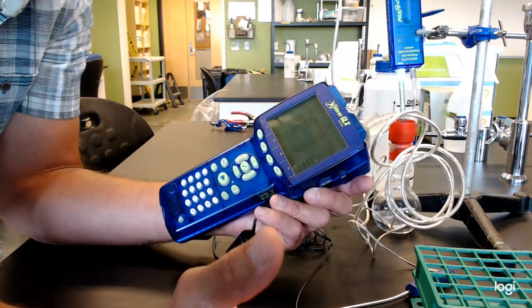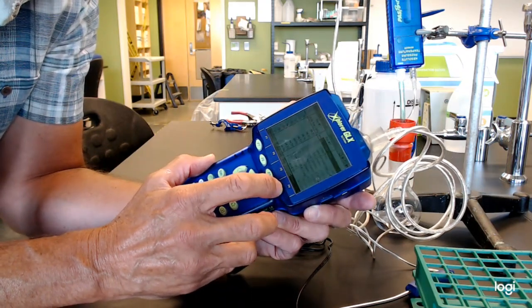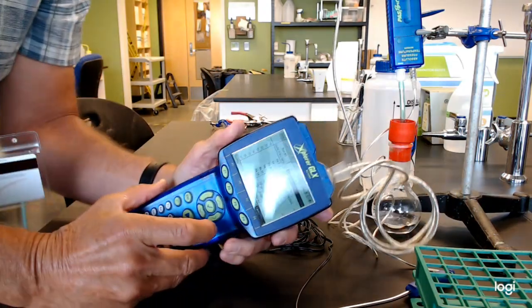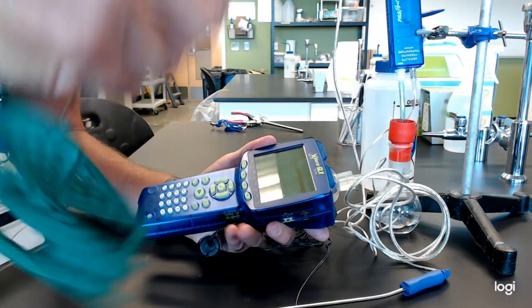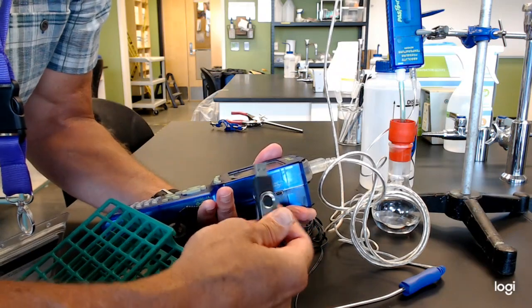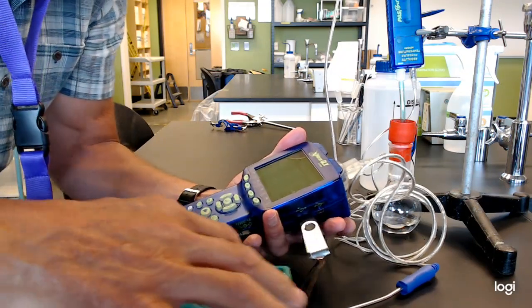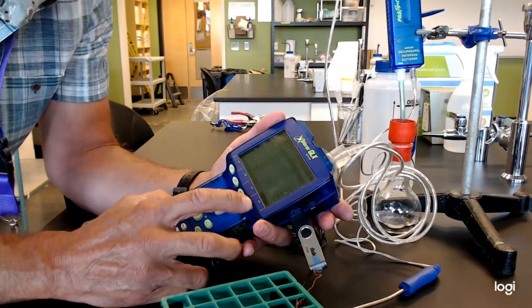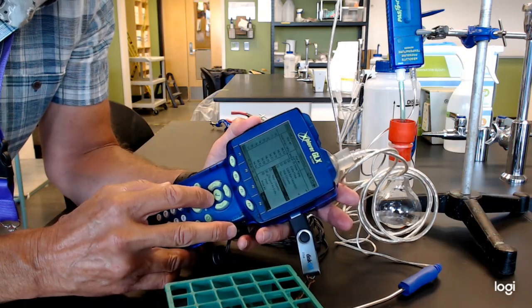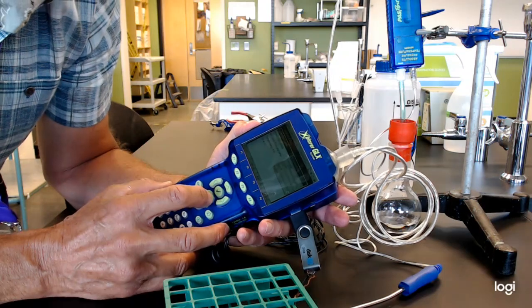So what I need to do now is I push my tables, F4, and it says export all data. Let's go ahead and get a card in here. We're talking during COVID time. We're saying students, bring your own flash drives. Here we go. F4, export all data.